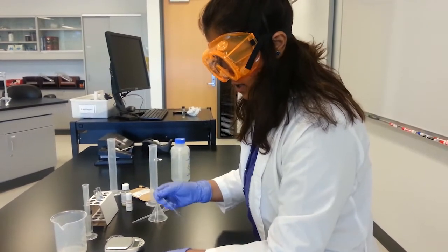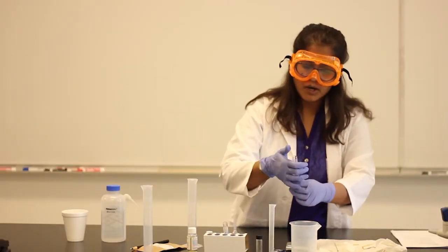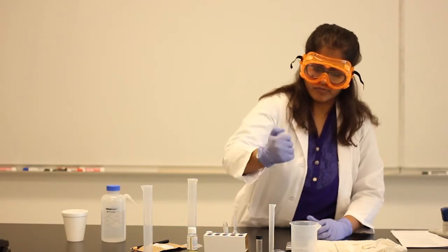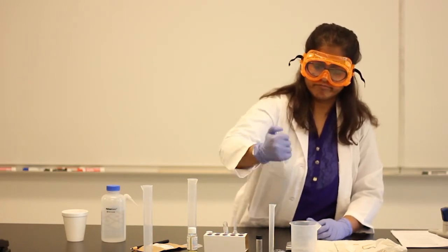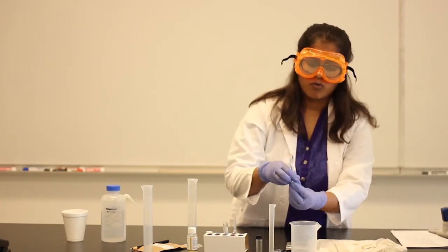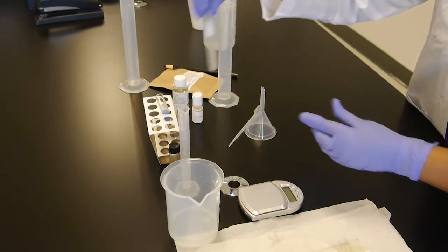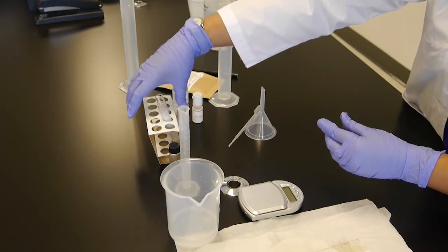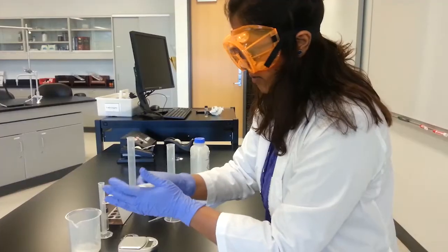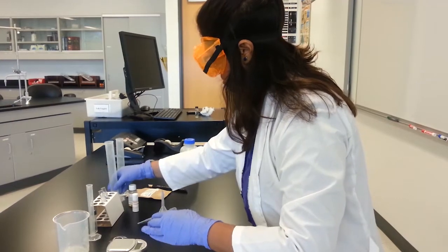All right. Now, let's do another thing. Let's see how much it foams out. So vigorously shake the mix. If it forms a good layer of foam like this, whatever you get, make sure to take a photo of it, and then we're going to see how it reacts with 2 different things: the vegetable oil, how is the layer, and another one is hard water mix.